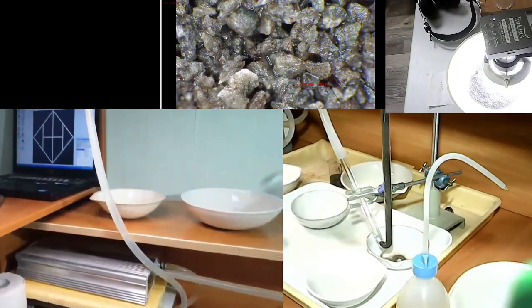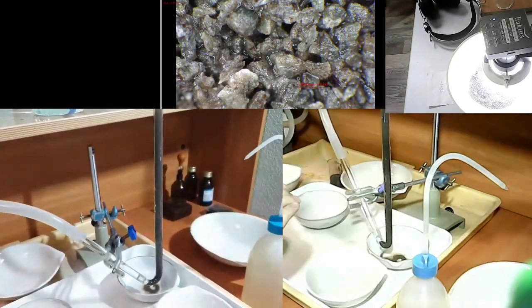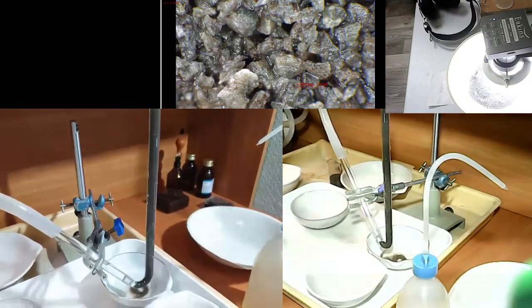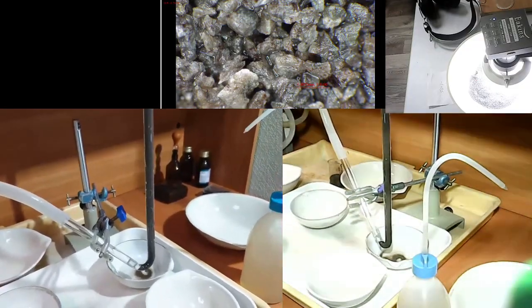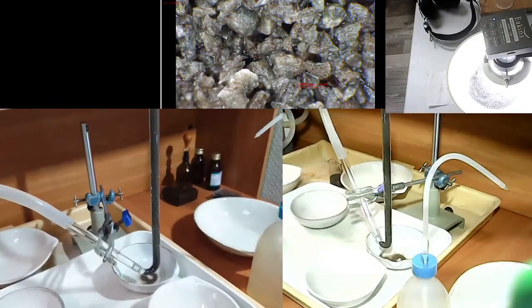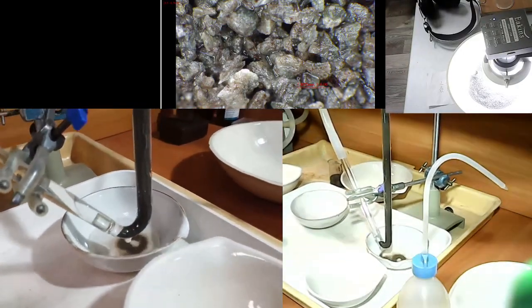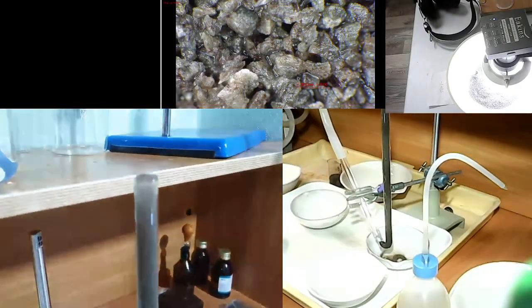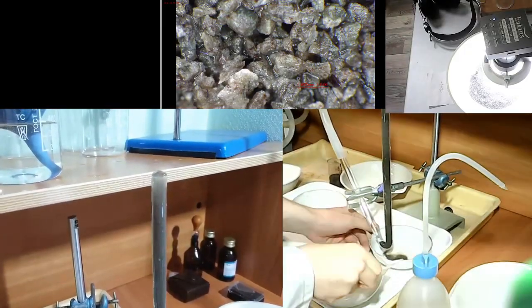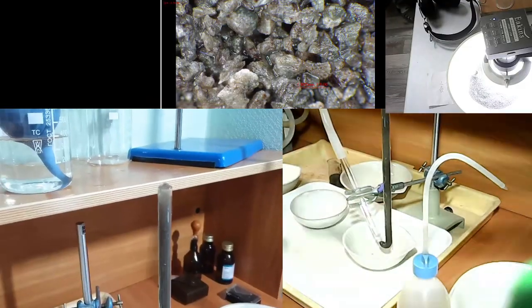We try and make density separation as accurate as possible. Within the different size range, it's possible to use density, physical density, as the factor of separation, right? So here is why we work with different size range. And the narrower the distance between different grain sizes, the better separation you would have. That's why we have those different 5 size fractions.